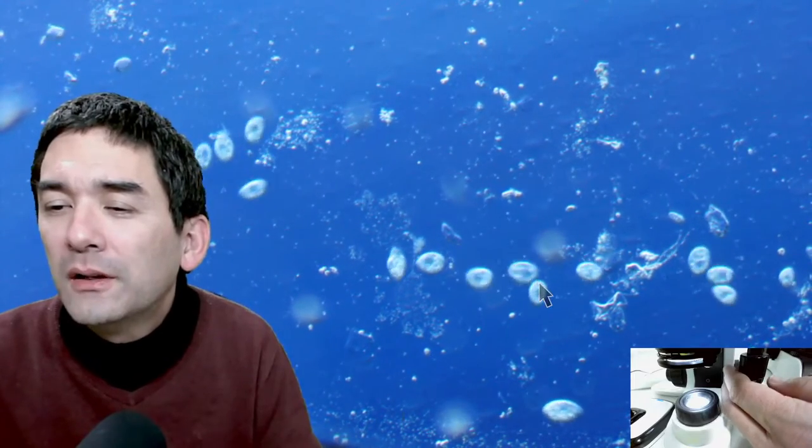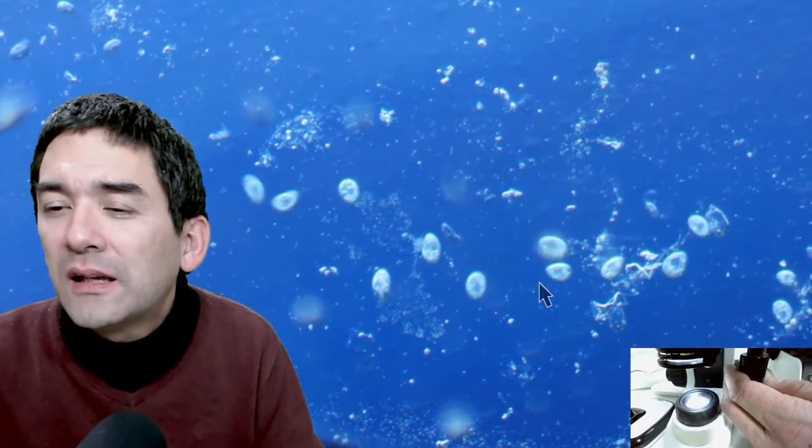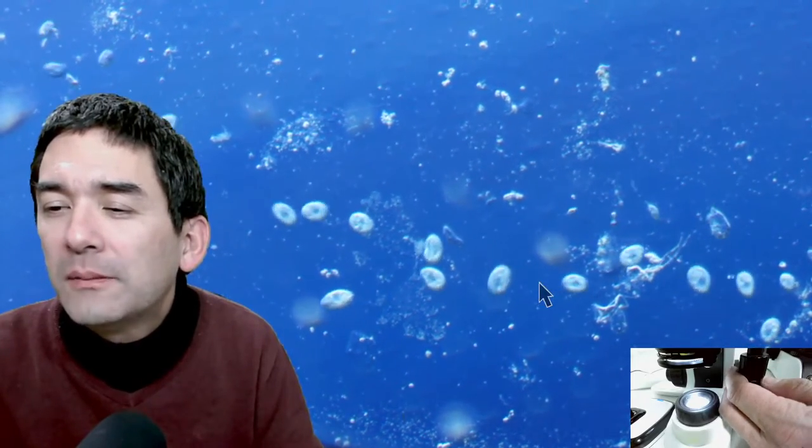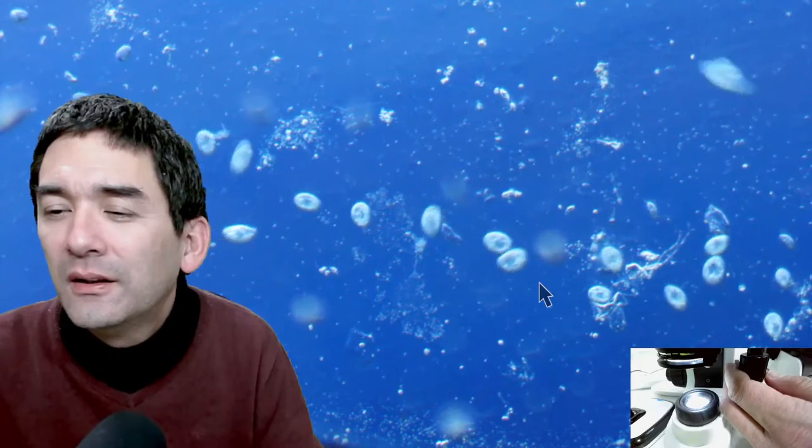A viewer suggests covering the bottom half or top half works better horizontally. Someone asks: have you ever tried using a kaleidoscope lens in the microscope? Never tried it — also interesting!